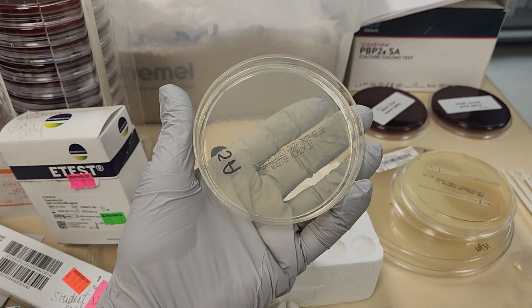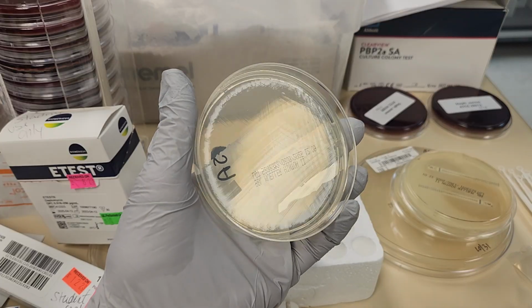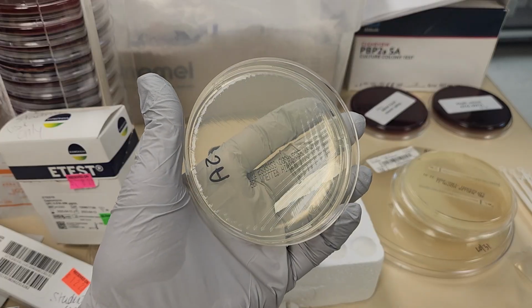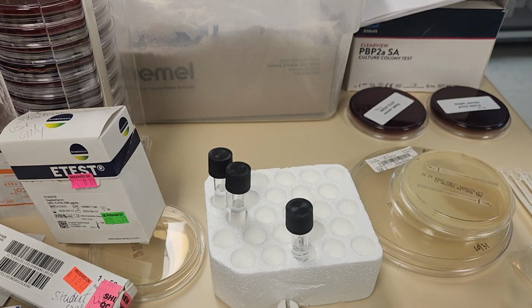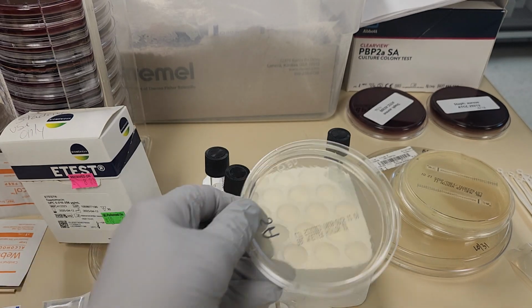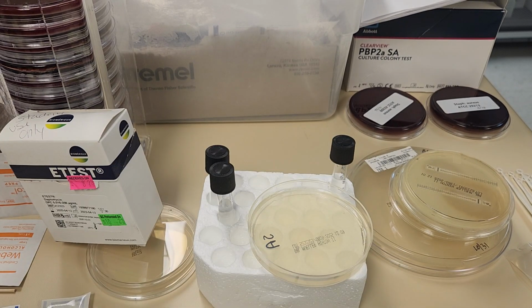And if you can see the lines of the streaking on this plate, you're going to notice that virtually the entire plate is covered by streaking. If you happen to streak for isolation, you really will get an incorrect result, because you will have gaps in your media.